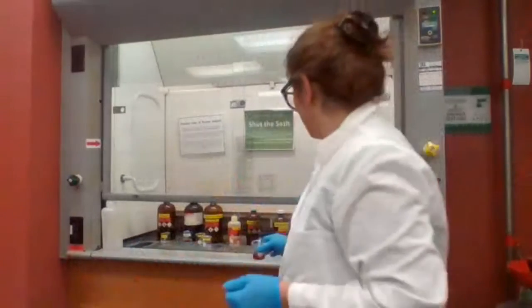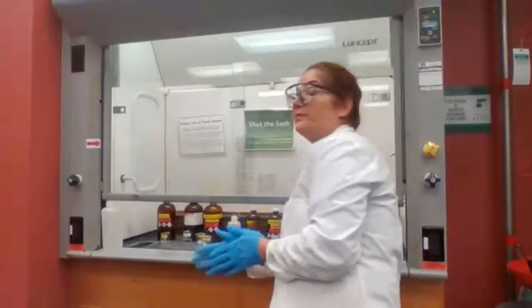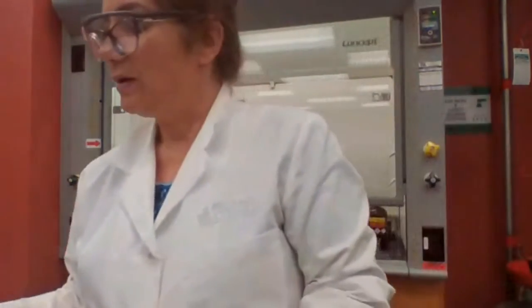It's funny that it's probably the first time I see the exact color that I expect when I do the experiment. Okay, next.